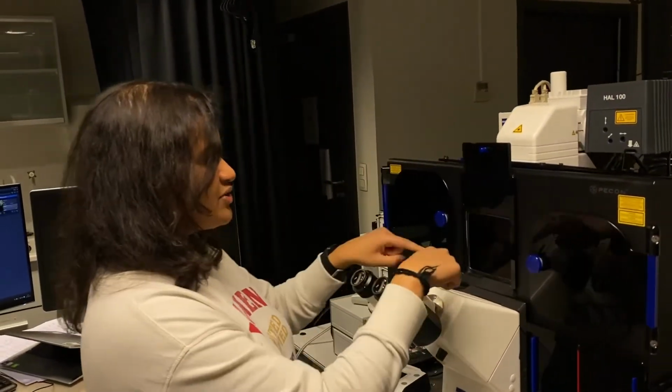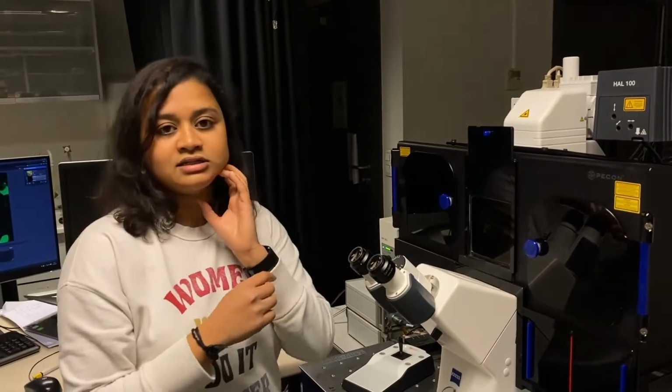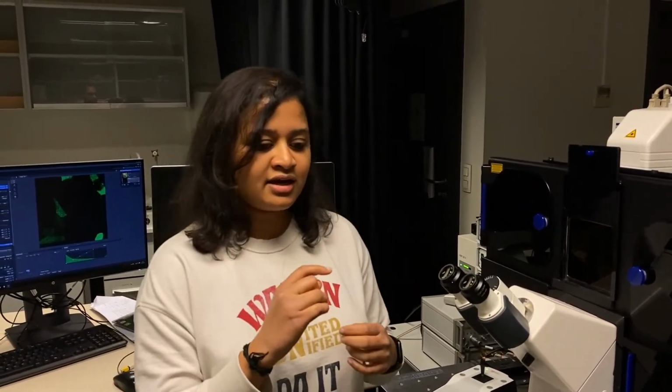As you can see, I have already placed my sample inside, and today I'm going to show you two different kinds of sample. One is EGFP in cells. The second is my protein of interest, which is Disrupted in Schizophrenia 1. It's a major protein that's involved in mental illness. I'm trying to understand many things about this protein, and in today's demo session we will focus on how this protein diffuses. That would be your actual experimental sample, and I have my DISC1 fused to EGFP, so that's why my control sample is EGFP in cells.